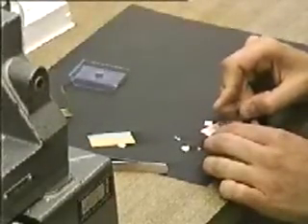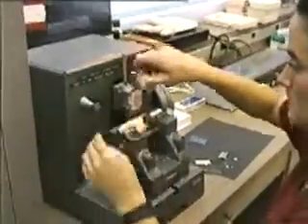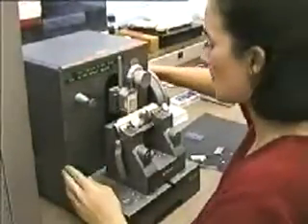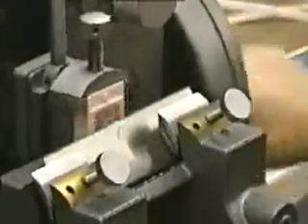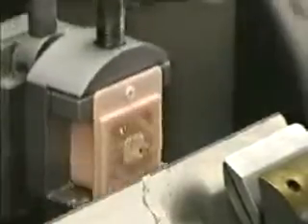After all four sides are trimmed, the specimen is inserted into a chuck at the end of a cutting arm on the microtome. Thickness adjustments are made and the operator now aligns the specimen with the knife. A nearby vaporizer provides atmospheric moisture to prevent static electrical charges from causing the sections to be lost. Each time the arm containing the specimen moves up and down, it also advances a small increment, thereby providing the movement needed for making a section.